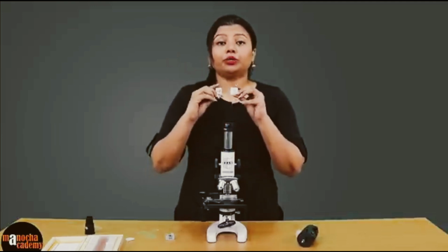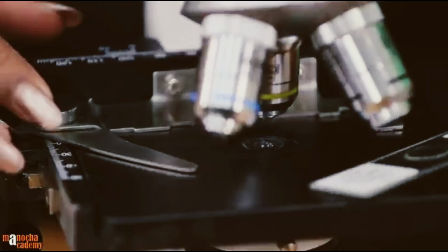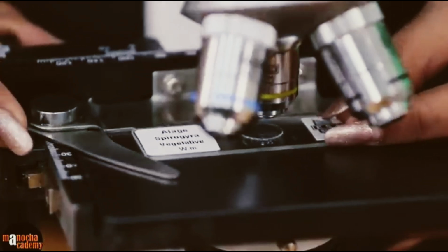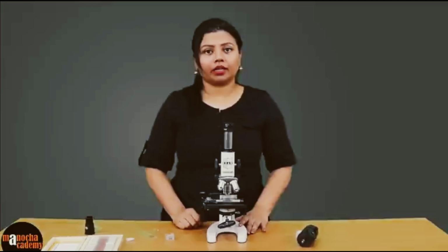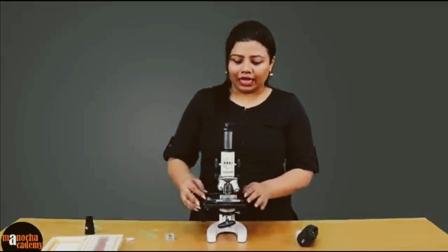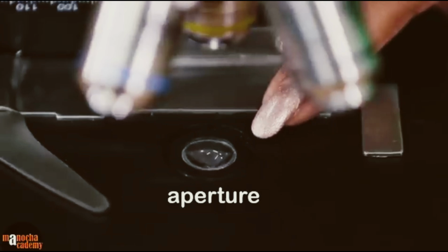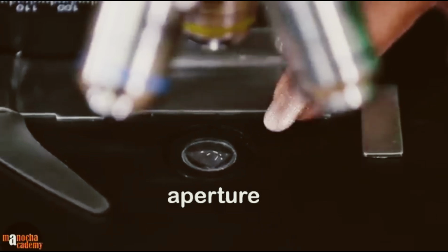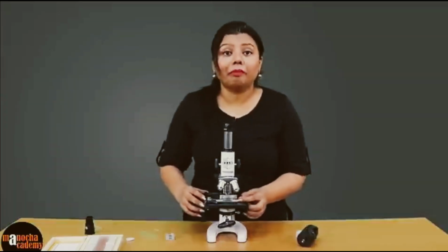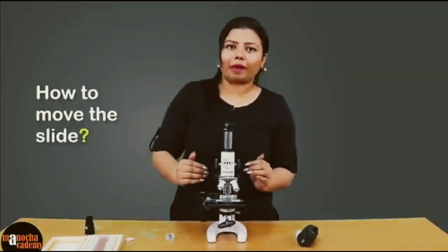So now what we'll do is we will take this slide and place it on the stage and secure the position of the slide with the help of the clip. Now with this, you have the slide on the stage. On the stage, there is a small aperture through which the light will enter and fall on the specimen. That is all right, but you might have to move the slide right, left, forward or backwards.